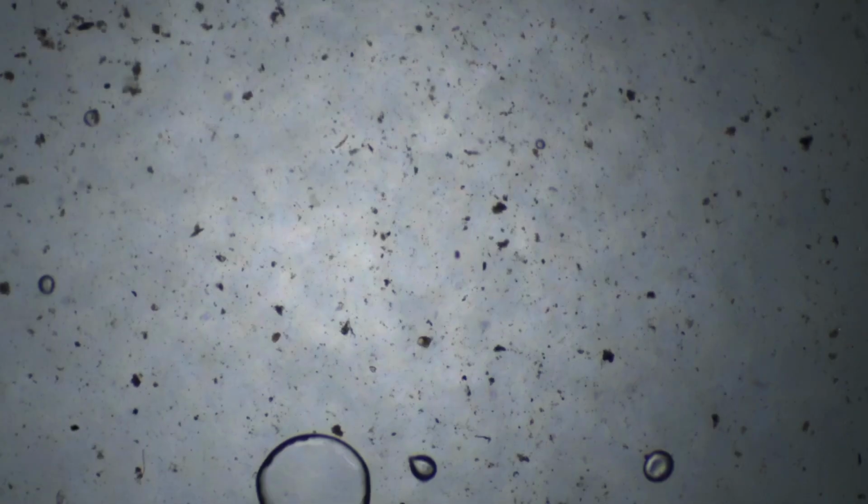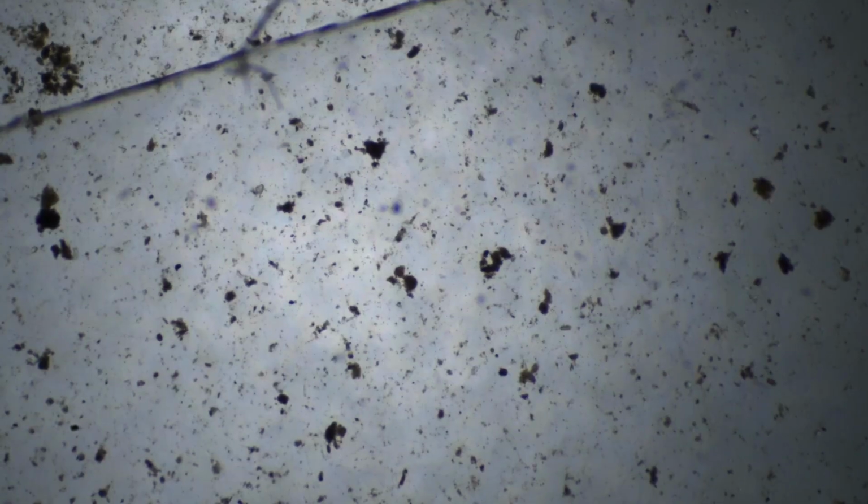We'll just have a brief little scan through this soil, and I'll point out anything interesting, try and give you some soil facts as we go. When we're performing some sort of qualitative soil assessment, we're looking for functional groups basically, and the presence of various trophic layers of biology, both single-celled and multi-celled, prokaryotes and eukaryotes. This is just to ensure that the nutrient cycling circle is functional.